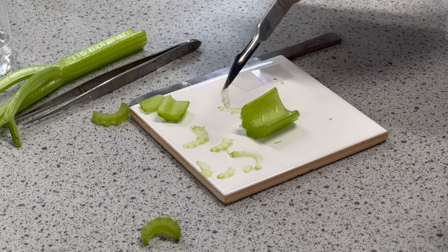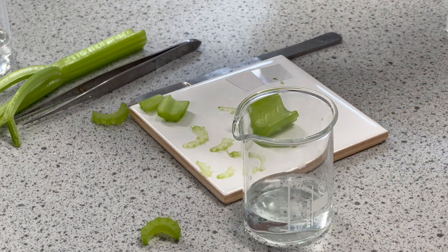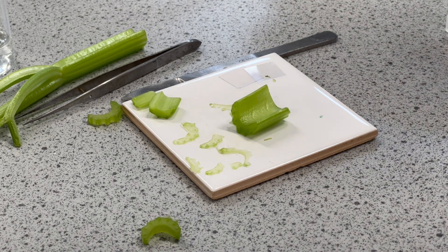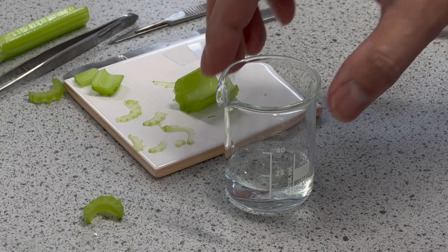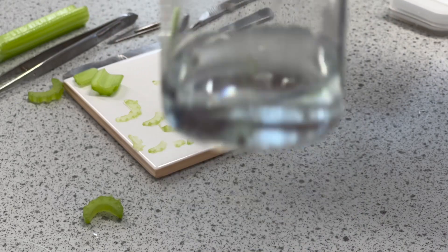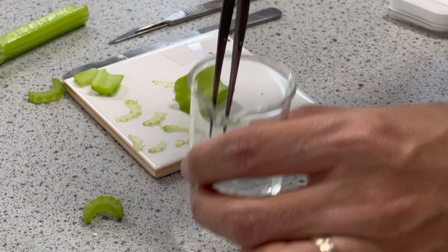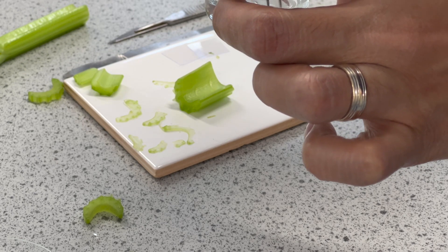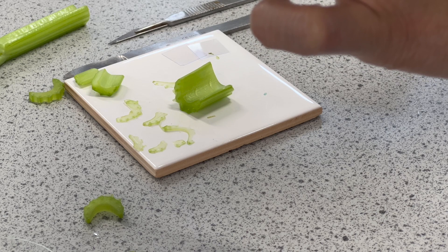Once you've selected your sample, you soak it in water — just put it in a beaker of water and leave it for a couple of minutes. When it's been soaking, take a pair of fine forceps and handle it carefully, because the quality of your sample and how well you keep it will determine the quality of the image you see at the end.